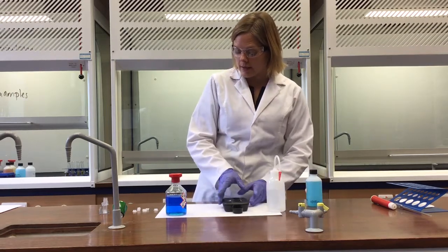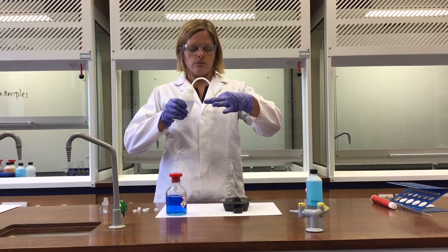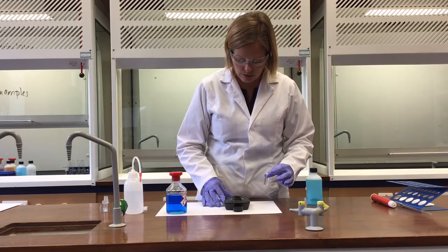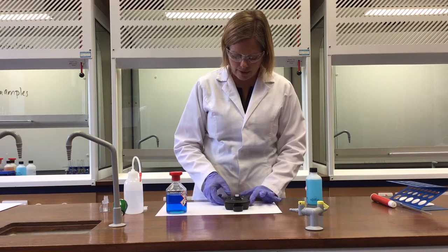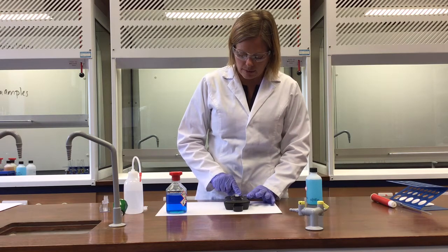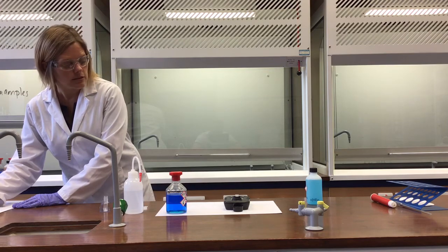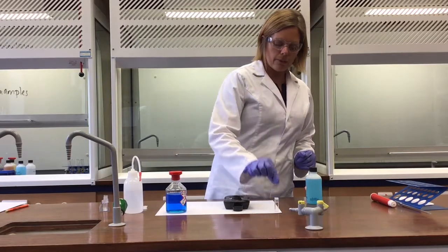So I'll just take the colorimeter now, and I'll start off with a cuvette and pop some distilled water in this one, like so. So I'll pop a lid on it so that it doesn't spill inside the machine and damage the machine. Turn the machine on. I'll just pop that into here. And I'm going to press the button there and calibrate that so that it's at 0. So for 0 moles per decimetre cubed, the absorbance is 0.00 on that scale. Remove that one.